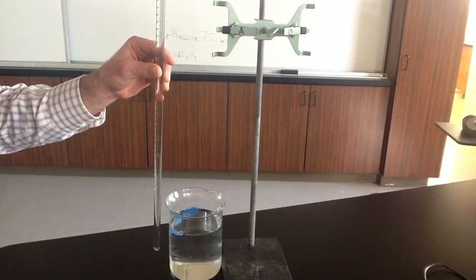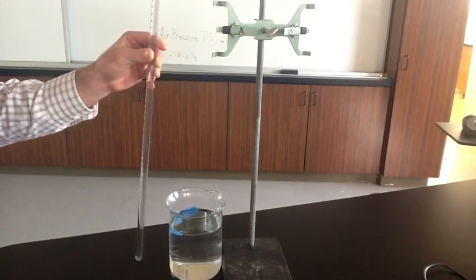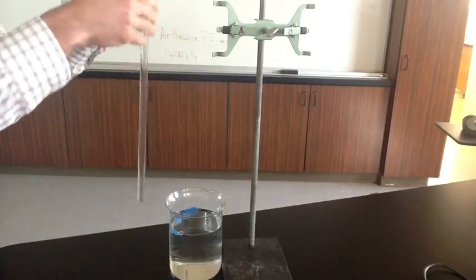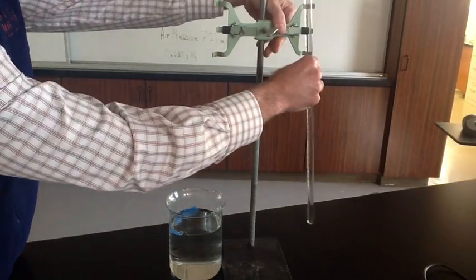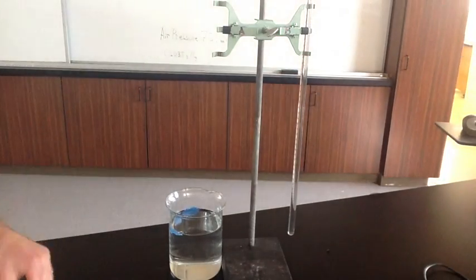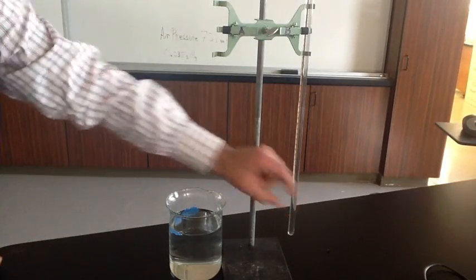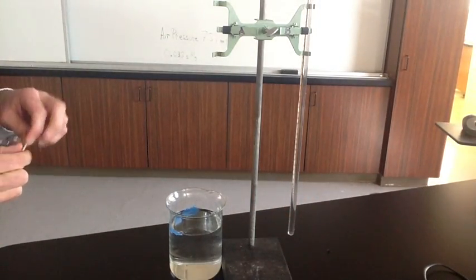And we're going to fill it with water all the way to the very top. So we have water to the very top of the burette, and we have hydrochloric acid down in this section. We'll let that sit right here for a minute. We're going to take our magnesium metal, and the magnesium metal will react with the hydrochloric acid down here in order to make hydrogen gas.